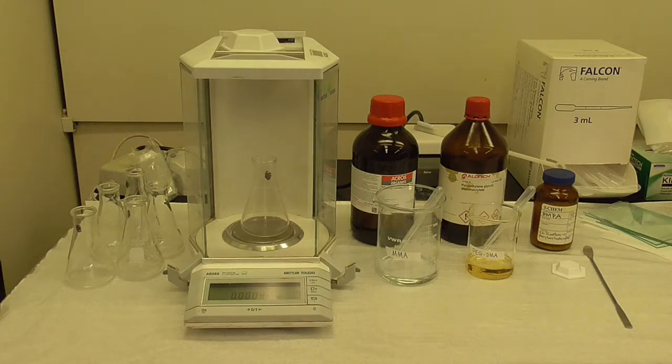Because the scale is in the hood you need to close the doors in order to make a measurement or tare. Now we put in the chemicals for the polymer synthesis.